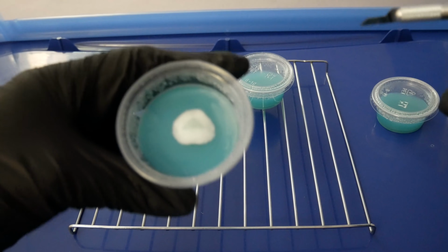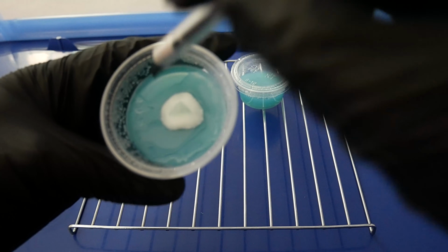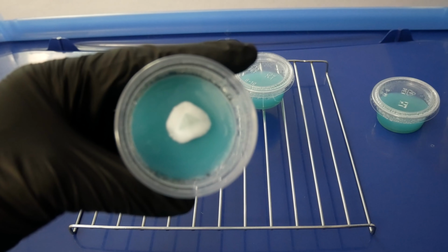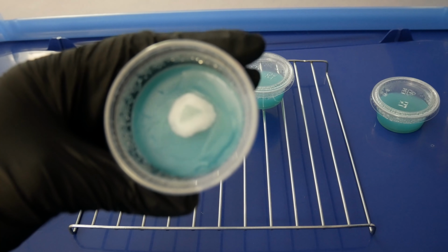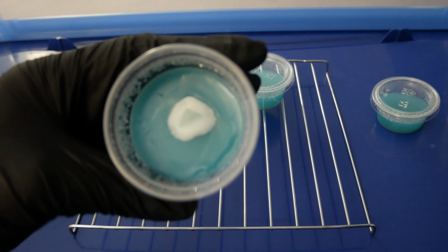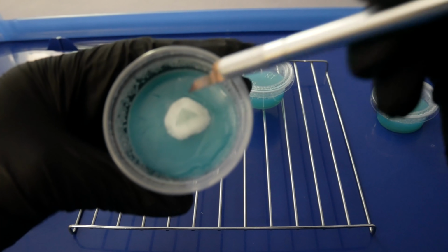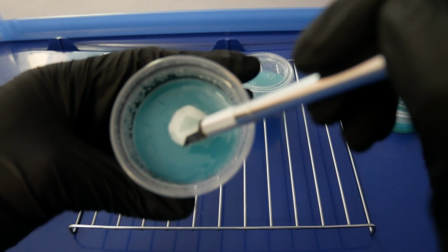Now we'll take a look at this. I kind of stabbed the agar there just to cool the blade. I did it in a spot that's away from the slime. I probably wouldn't recommend you guys do the same thing. You probably want to cool it down in a clean plate.